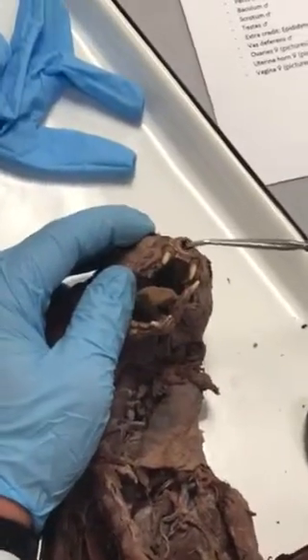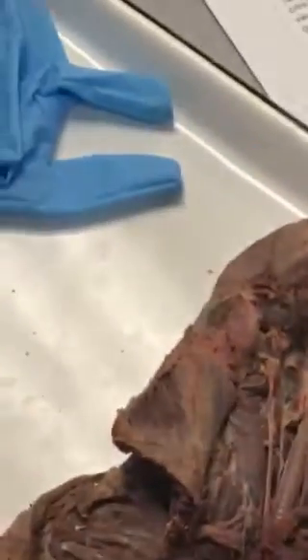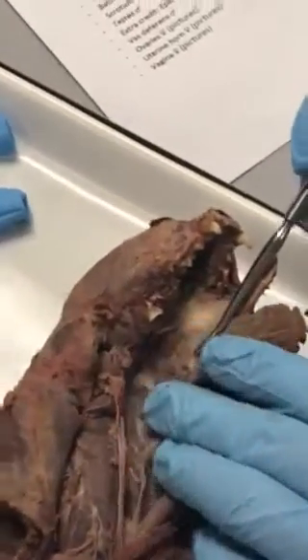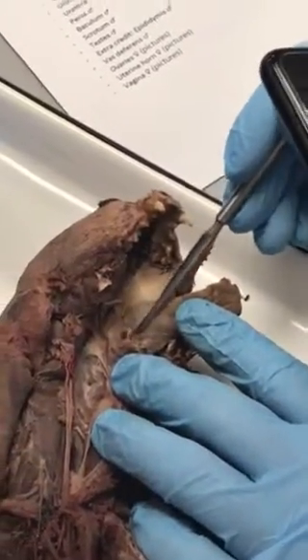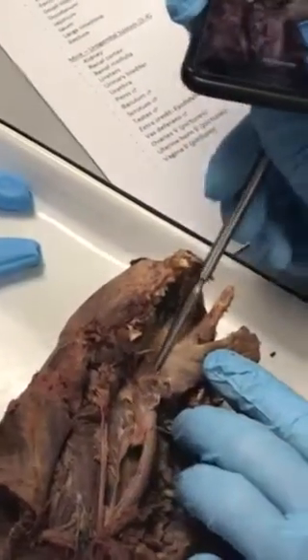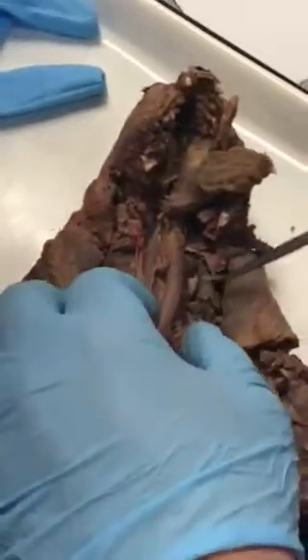These are the external nares right there. And then opening up the jaw, we see our tongue right there. And then our internal nares is this hole right there, followed up by, at the base of our trachea, we've got this sort of bat ear structure. That's our epiglottis, and that leads into the hole, which leads into our trachea, which is the glottis right there. And then that, of course, leads to our trachea with the little bumps.